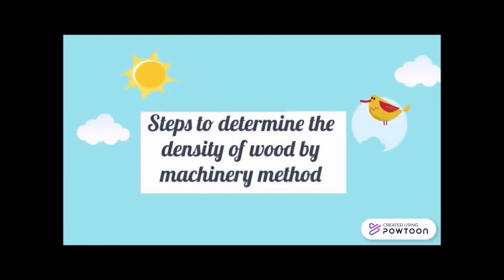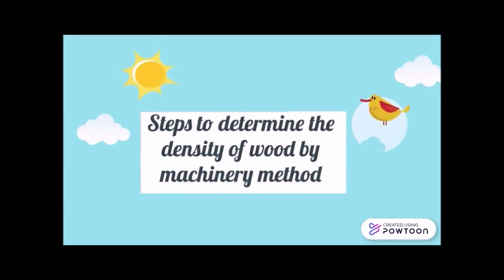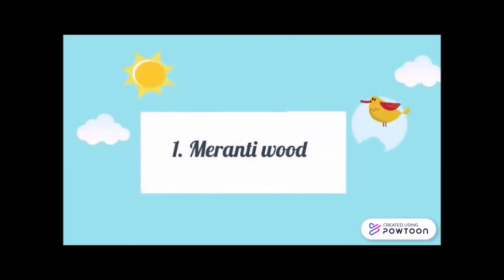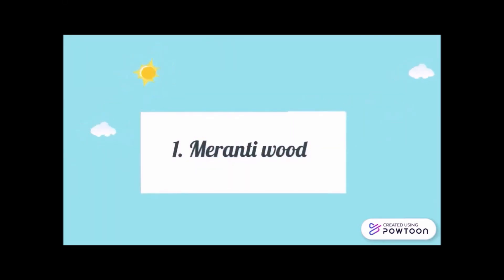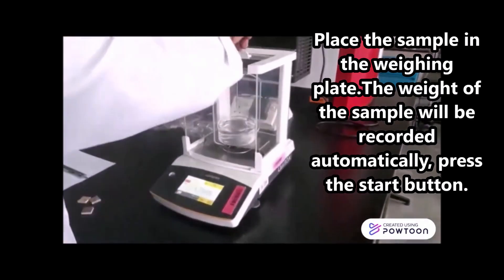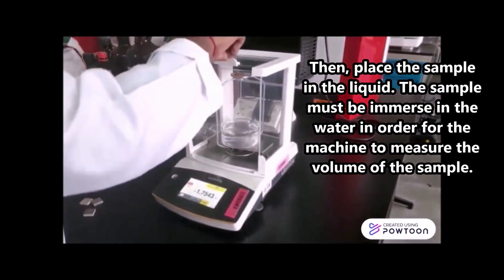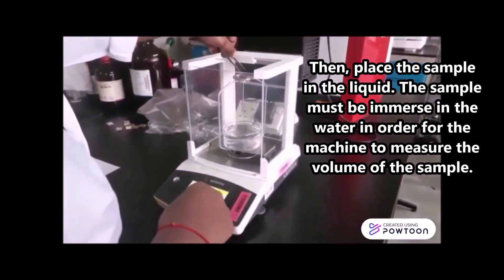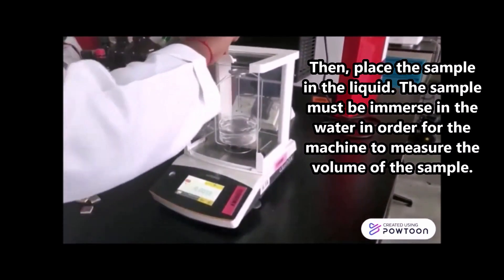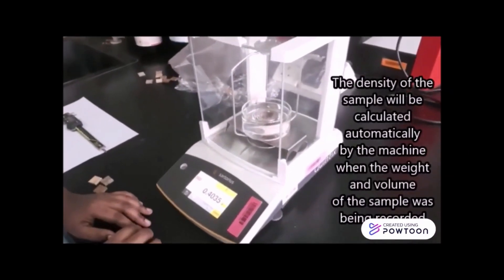After understanding how to determine wood density manually, let us proceed with the machinery method. First, we take the meranti wood and place the sample on the weighing plate. The weight of the sample will be recorded automatically. Press the start button, then place the sample in the liquid. The sample must be immersed in the water in order for the machine to measure the volume. The density is then calculated automatically by the machine.